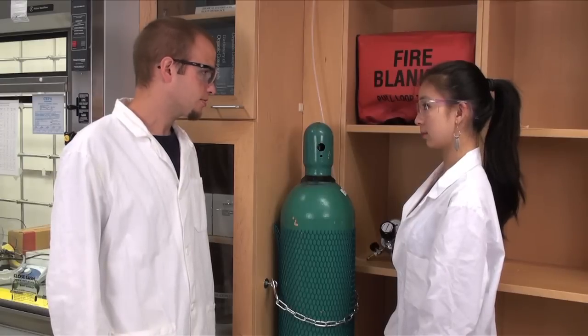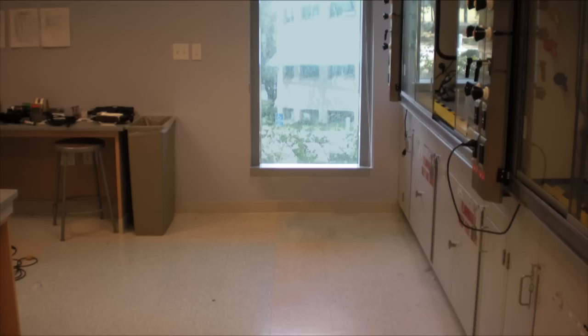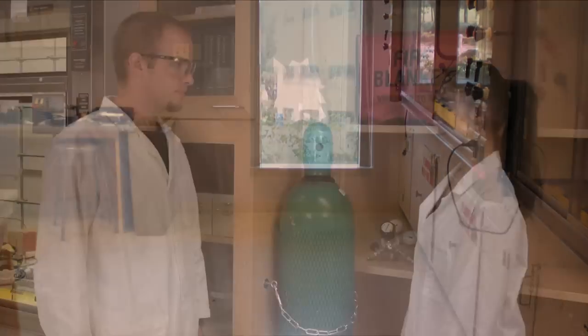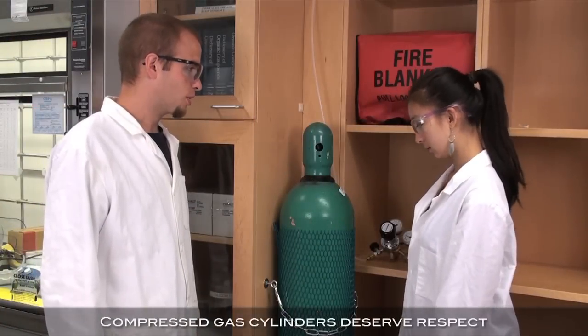If the valve were to be knocked off, the whole thing would take off like a rocket. Okay, let's take this one back to the warehouse and get a new tank.